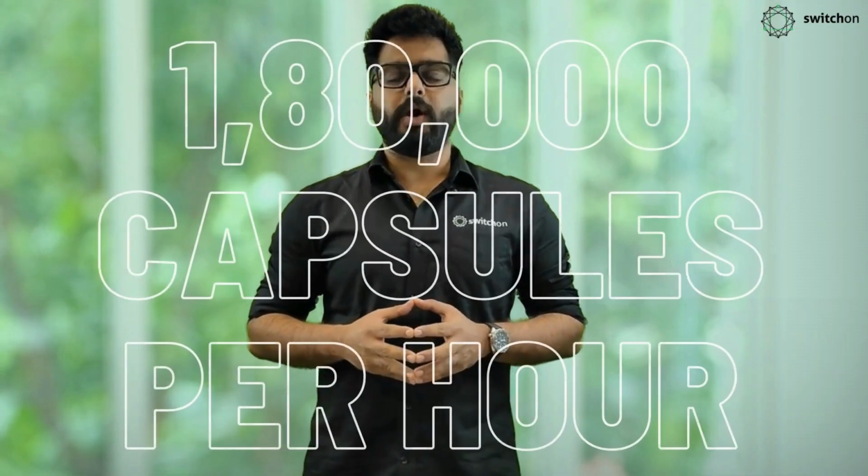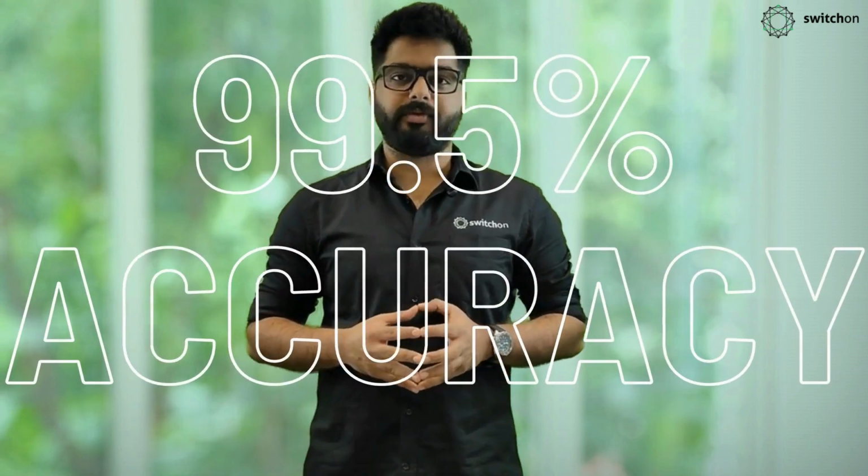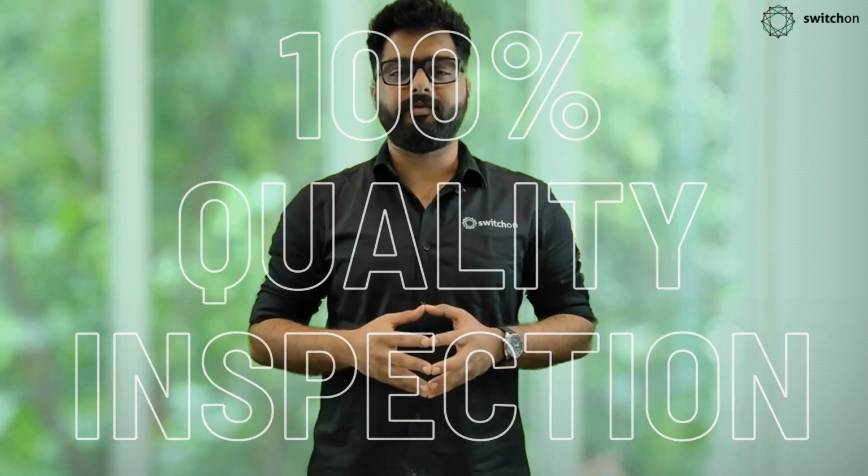We are able to effectively inspect capsules at 1.8 lakh capsules an hour and at accuracies of 99.5%. With this, and reduced wastage, you are able to effectively ensure 100% quality inspection for each and every capsule that you produce. DeepInspect is compatible with a host of industrial-grade hardware.